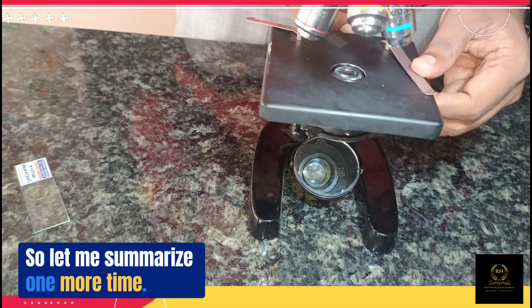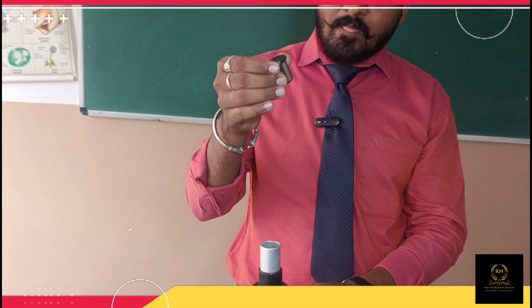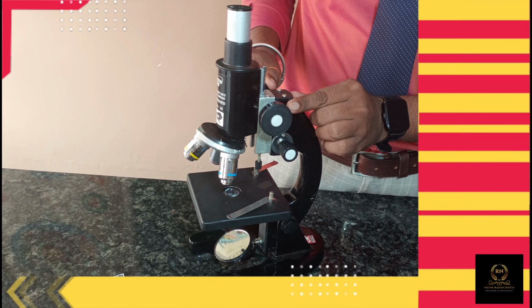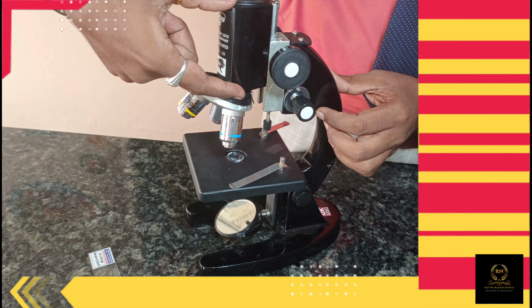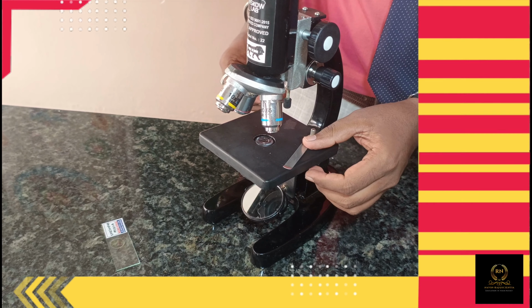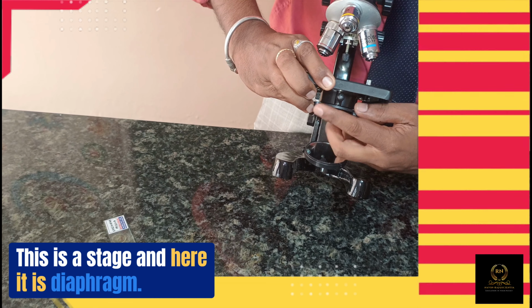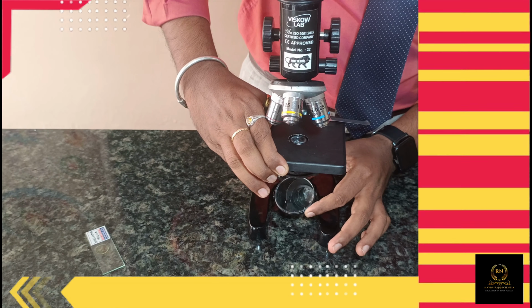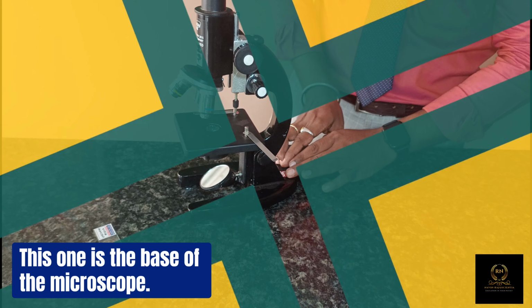So let me summarize one more time. This one is the eyepiece, this knob is the coarse adjustment, then the fine adjustment, the handle of the microscope, the body tube of the microscope, and these three lenses are the objective lenses. These are the clips. This is the stage, and here is the diaphragm. You can control the amount of light, and this is the light source. The mirror is the light source, and finally this one is the base of the microscope.